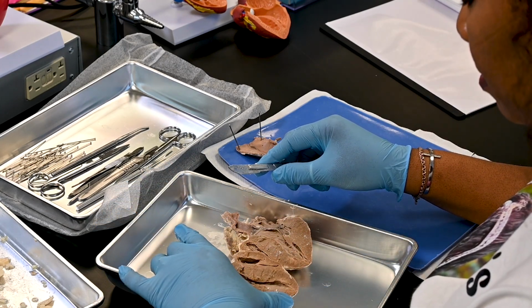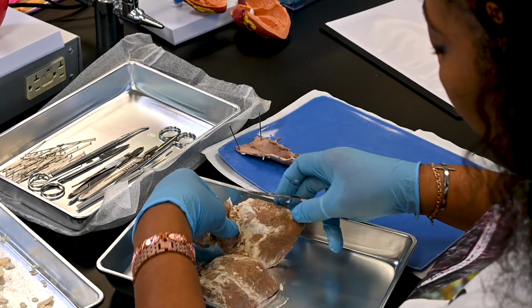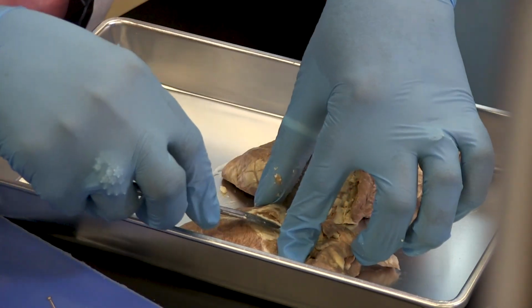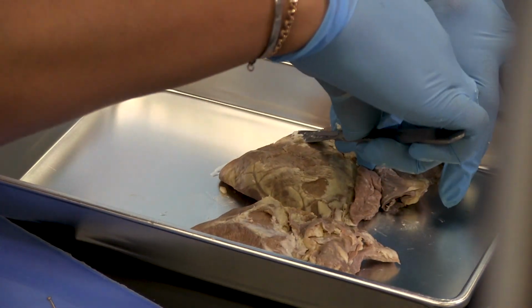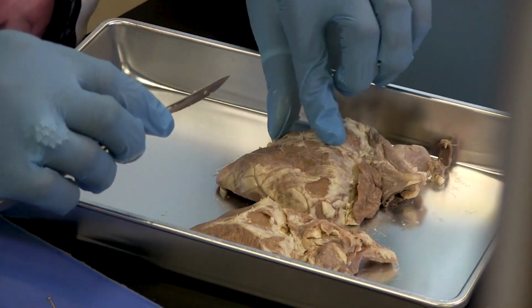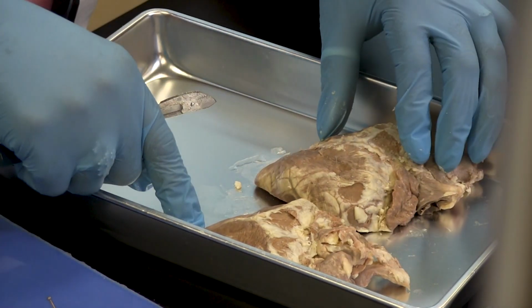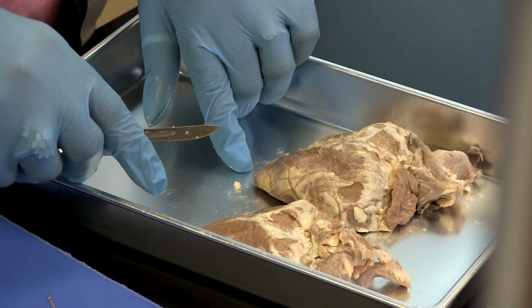Examine the external surface of the heart. Notice the accumulation of adipose tissue, which in many cases marks the separation of the chambers and the location of the coronary arteries. Carefully scrape away some of the fat with a scalpel to expose the coronary blood vessels. Identify the base and apex of the heart, and then identify the two wrinkled auricles, ear-like flaps of tissue projecting from the atria.